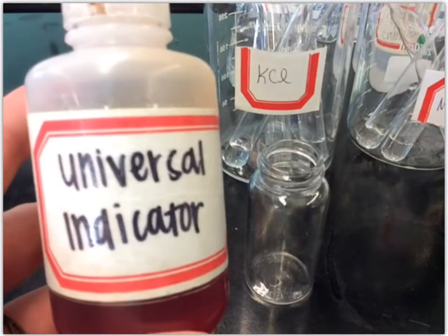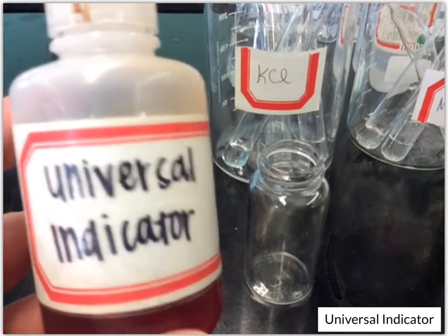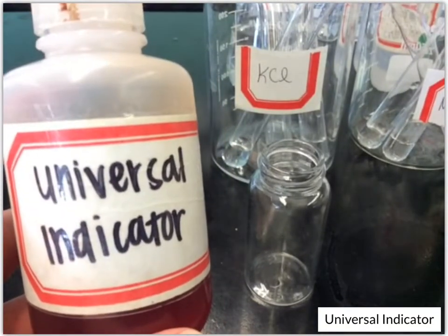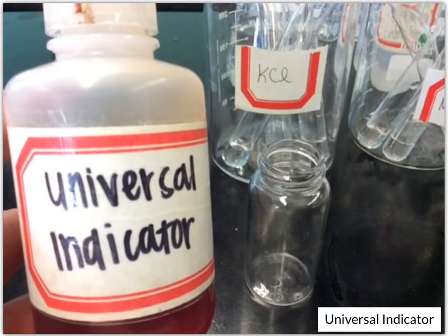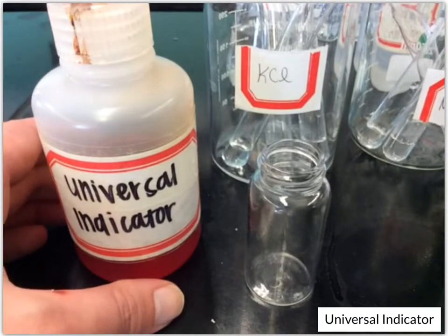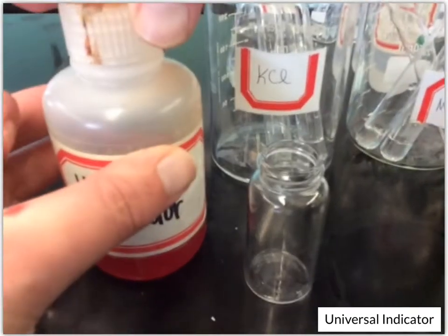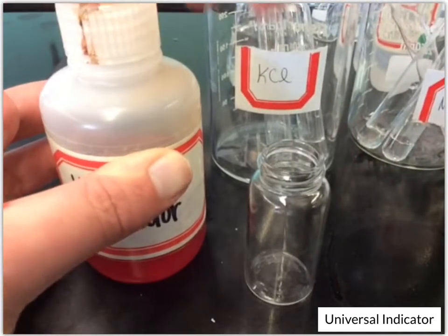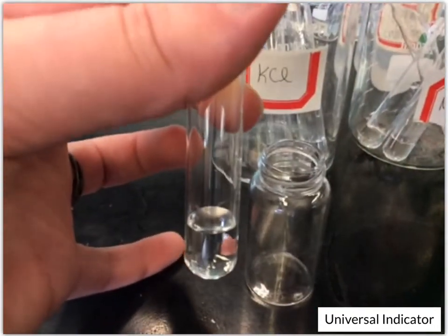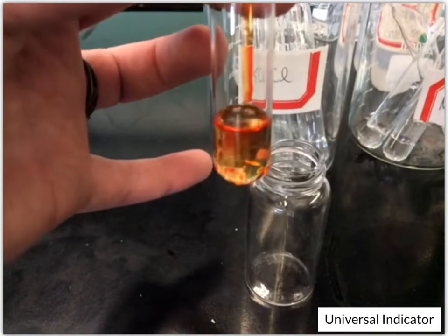Next, we're going to use what's called a universal indicator. So this is actually a mixture of several indicators, and so it doesn't just have one color change, it has several different color changes throughout the pH range. So we're going to use this to test all of our substances and see what color we get from each. So first we have the KCl, and I'm not even going to add 10 drops. An indicator, usually you only need a drop or two, or actually for this small of an amount, a drop should be sufficient. I'll add maybe 3 drops.